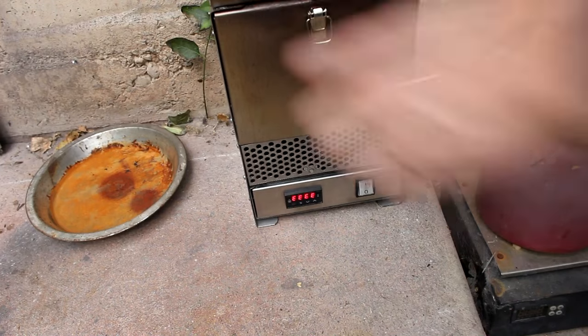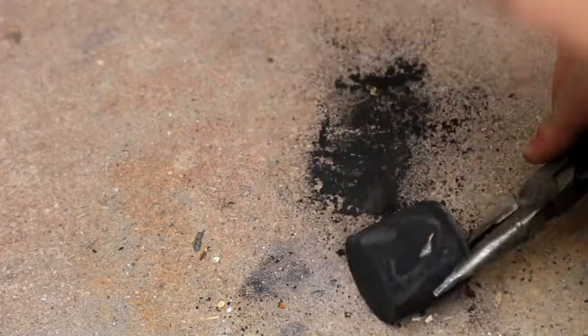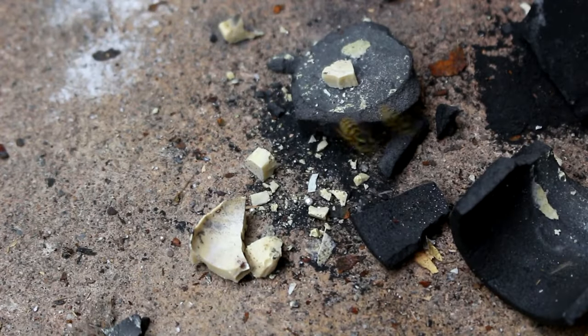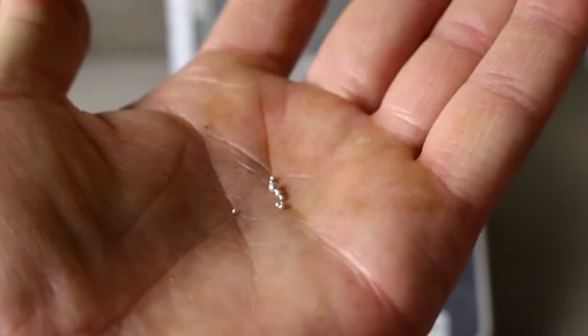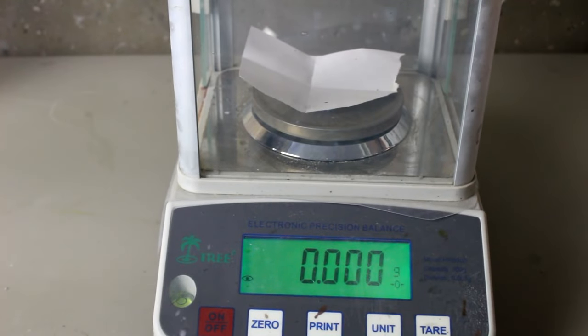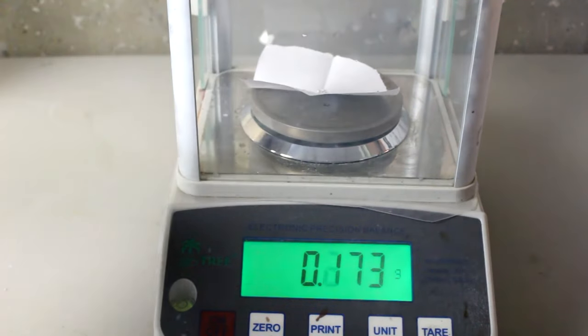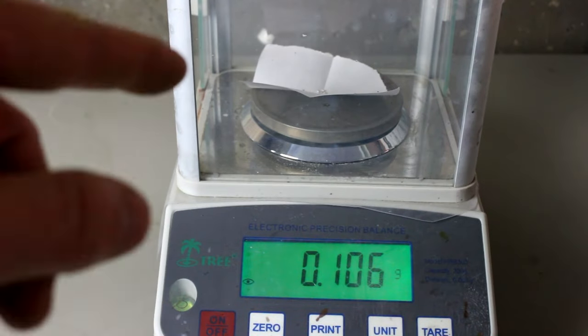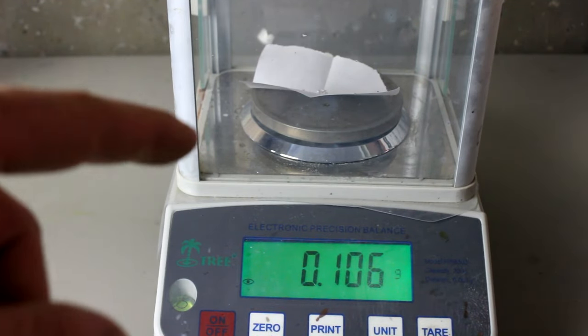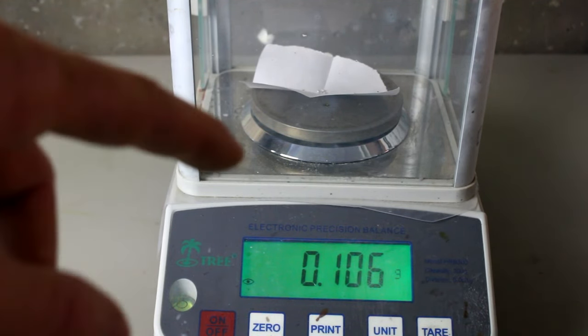In the meantime, it did melt the silver. How about we just break it out of this little crucible instead of pouring it out. Oh, hello bug. Go away. So you can probably see right here that there are some beads of silver. Not very much, is it? So let's set this over here on my weighing paper. There we go. Looks like around a tenth of a gram. Now, of course my recovery is not going to be 100%. I lost some because the furnace wasn't hot for long enough. And, you know, the microscopic beads didn't come together. But I don't think I lost 90%, right? I would imagine 10 to 30% is what my losses are here.